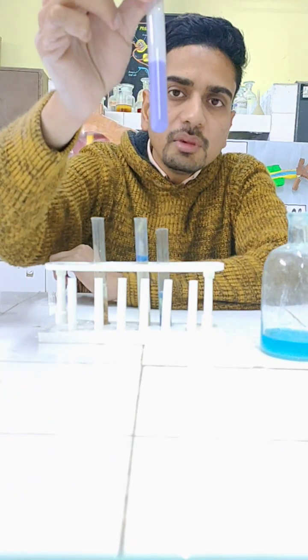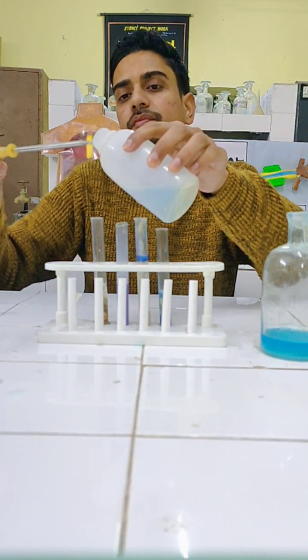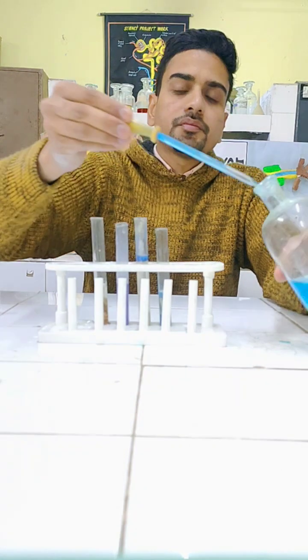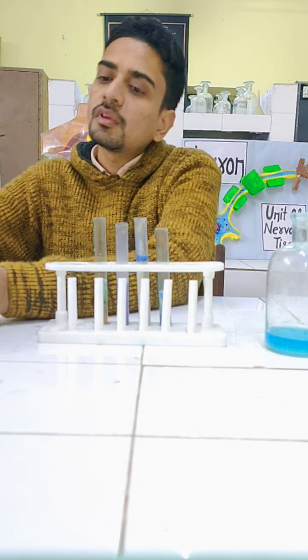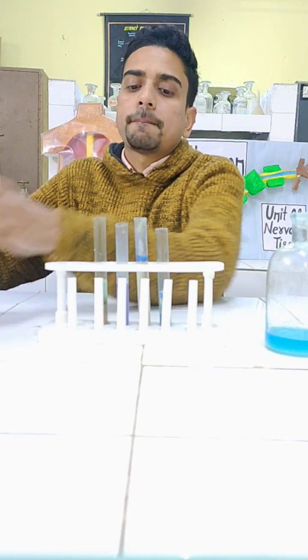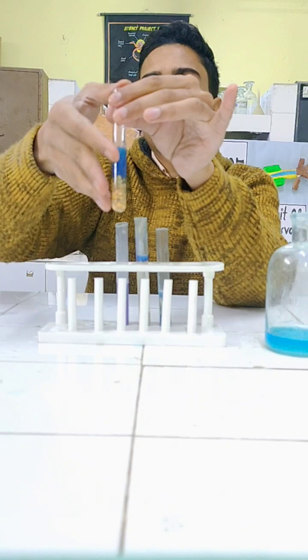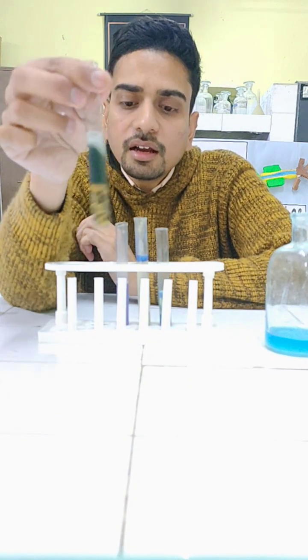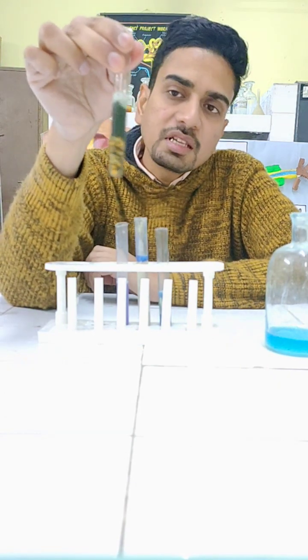Let's check for pulses. Clean the dropper. Two drops of copper sulfate into the mixture of pulses, and ten drops of caustic soda into the mixture of pulses. Shake it — and we clearly get a dark violet color, even more than milk. This indicates that a large amount of protein is present in pulses.